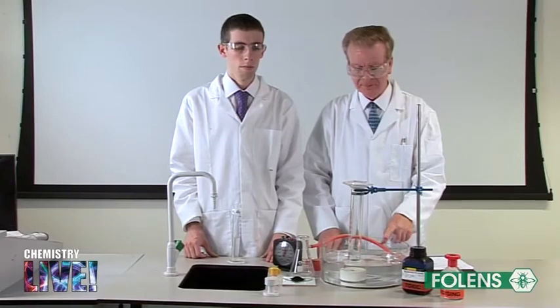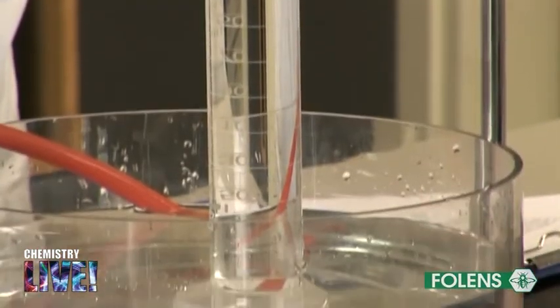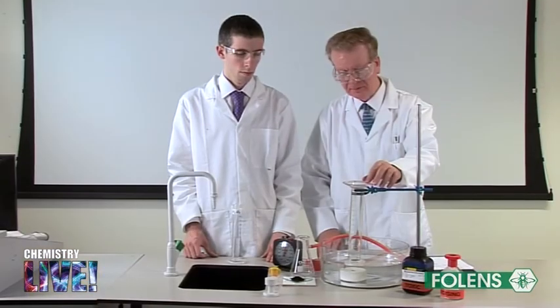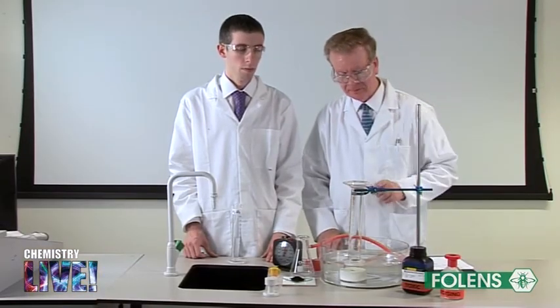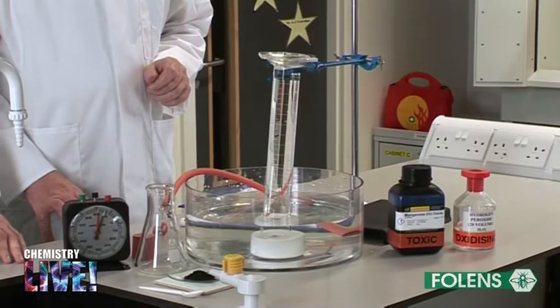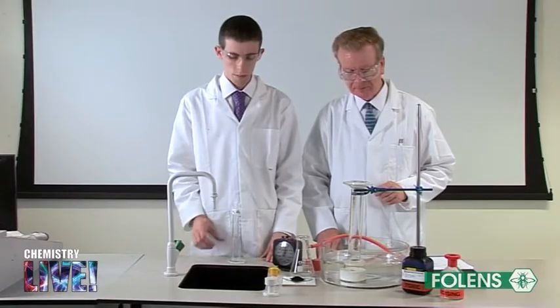Here we have a trough filled to about half its capacity with water. A 250 centimetres cubed graduated cylinder filled with water was inverted over a beehive shelf standing in the trough of water.